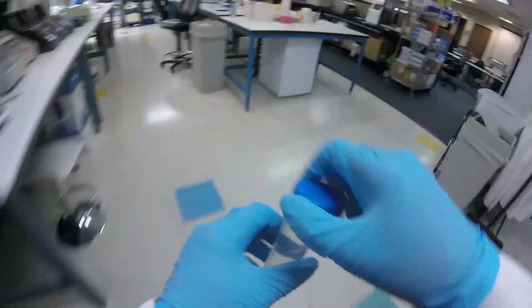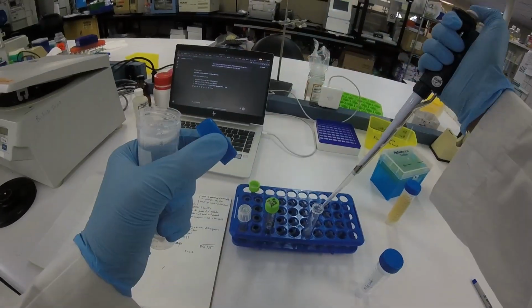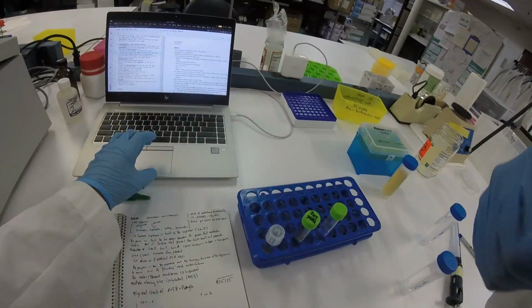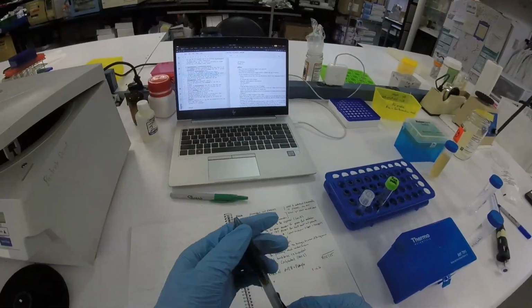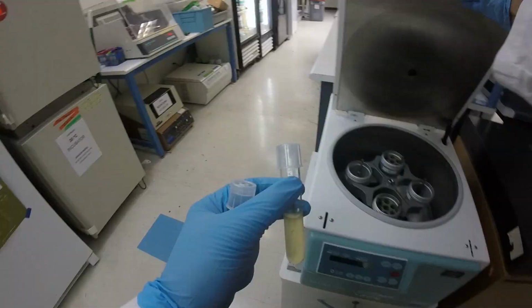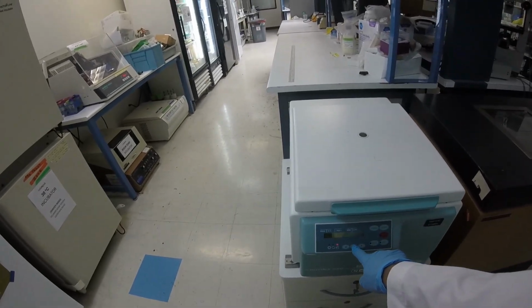I did want to explain the reason why you add glycerol to these stocks, in about, from what I've seen, 15% volume: it disrupts the nucleation sites of the ice crystal formation. So if the ice is growing in this crystal structure and there's this glycerol and it gets in the way, then the ice crystal won't be as big and thus doesn't have as much of a chance of destroying a cell membrane or something. The other thing is it lowers the freezing point, so less of the water, I guess, actually freezes.